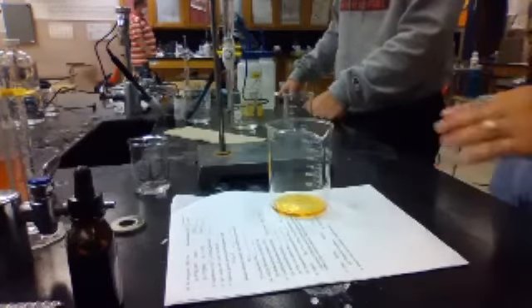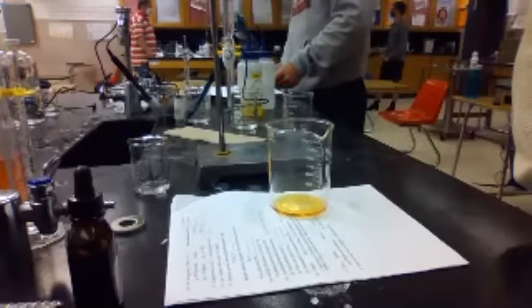For the H plus, I got 1.02. Yeah, that's what we got. Okay, so now that we put in 4 drops, we found that. So you guys need to find number 6.